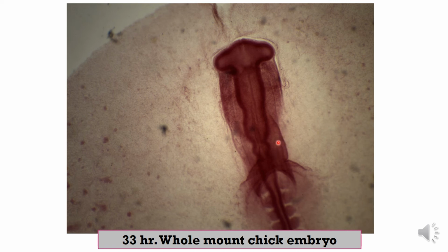This is the single heart tube, formed from anterior to posterior by the bulbus cordis, ventricle, atrium, and sinus venosus. This is the two horns of the sinus venosus. Okay, this is the heart tube, and this is the two horns of the sinus venosus.